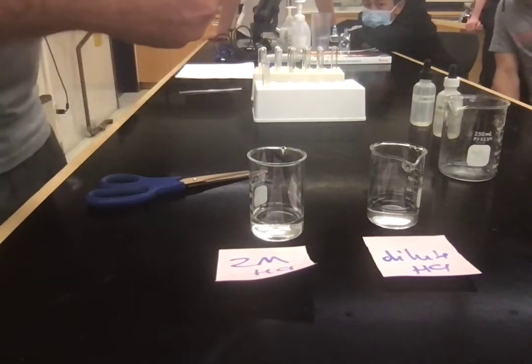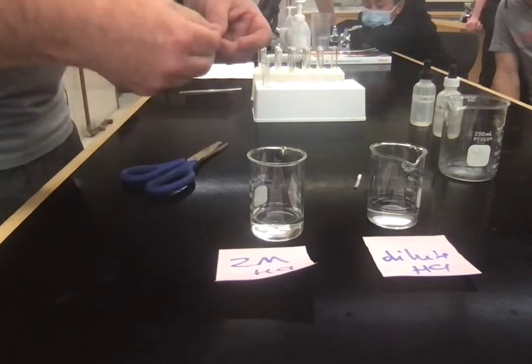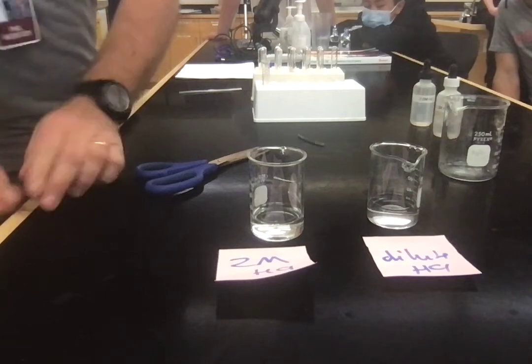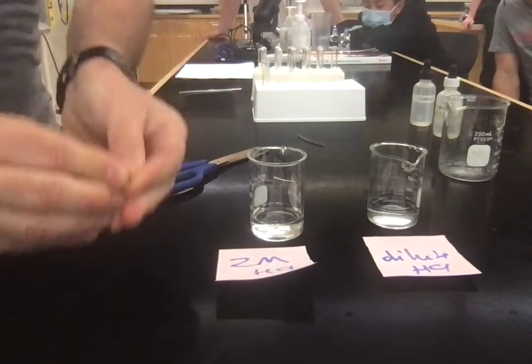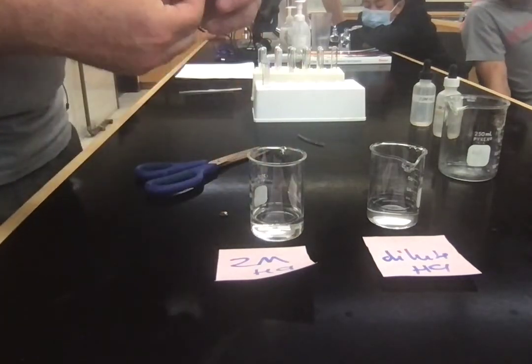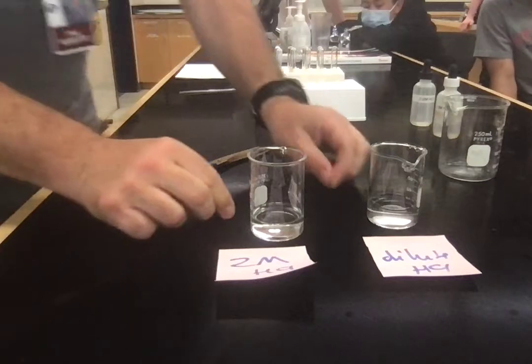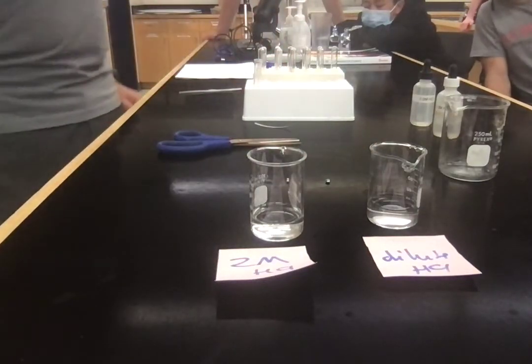Now, let's go. So this one, and so the same length. Fold them both up. Fold and roll. Show the camera. Fold and roll. What happens if you put magnesium into just water? Very, very slowly. In hot water it goes a bit better. In steam it goes really well.